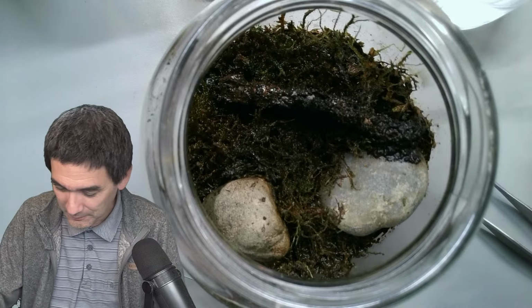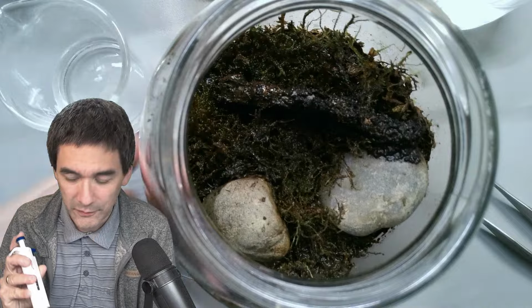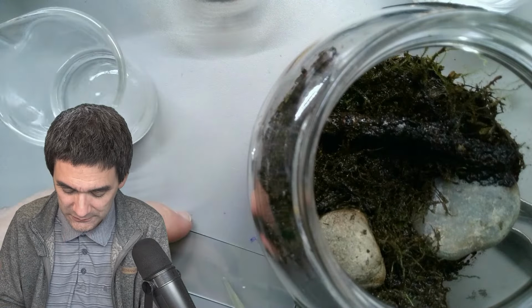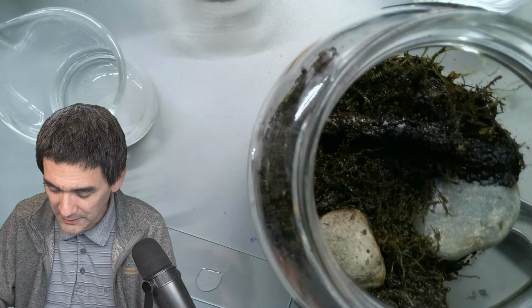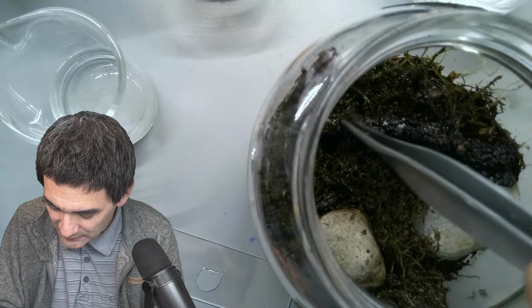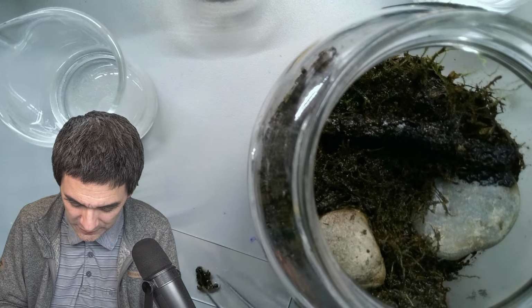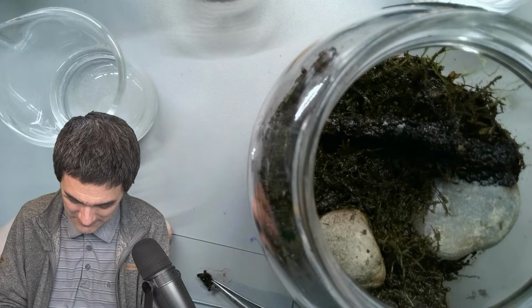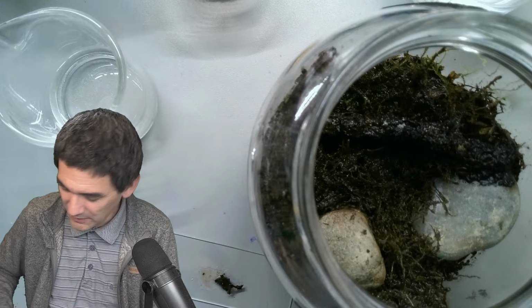So, what we do is the following. I always do this: I take a little bit of water and put it on the microscope slide here. And now we take some of this disgusting looking thing from the wood, and we dip it in the water. Gee, it absorbs the water. And I really would like to know what's in here.